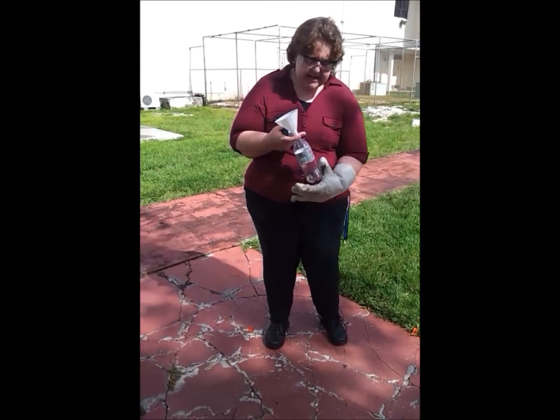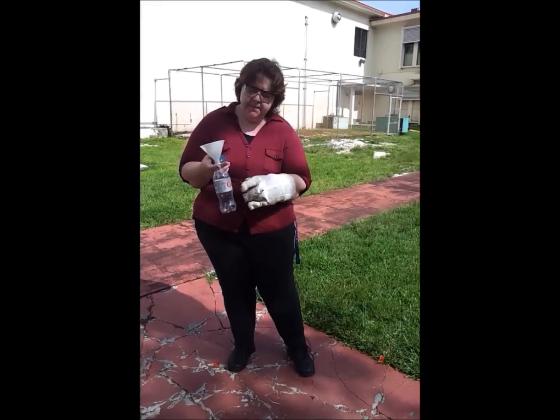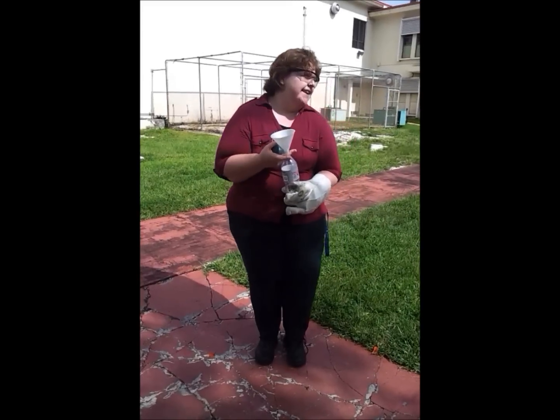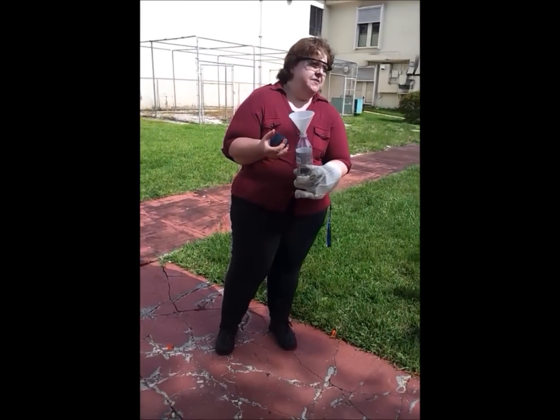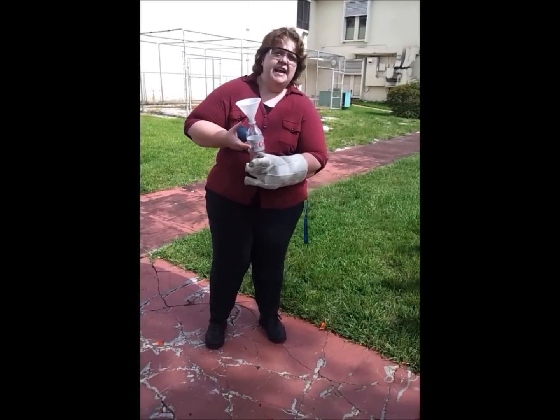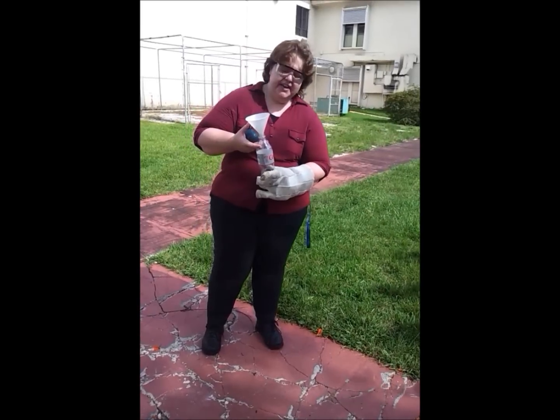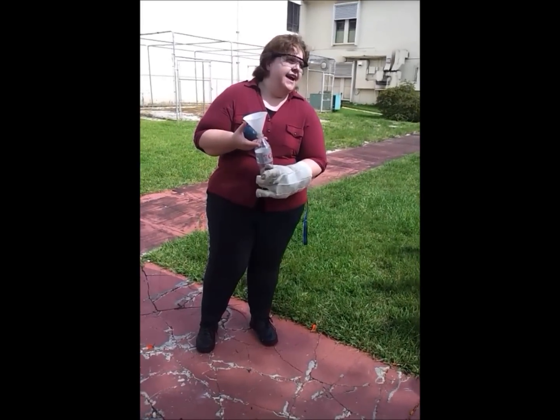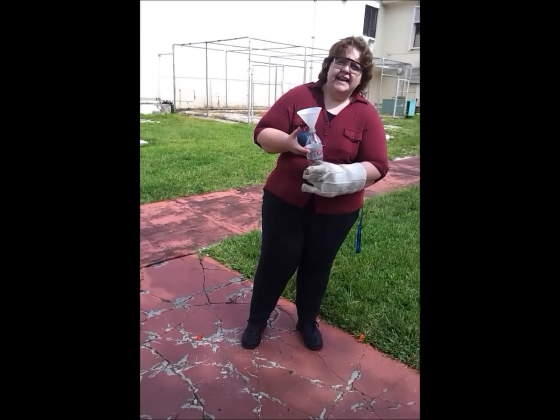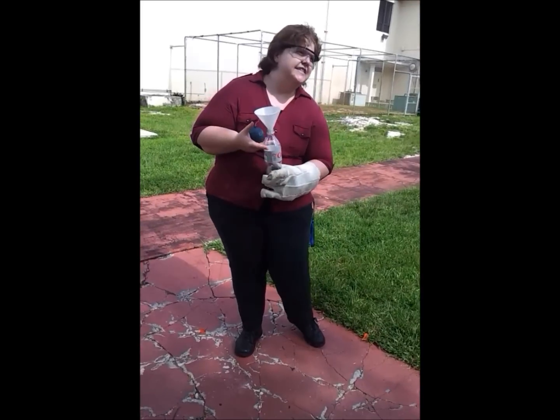So what we're going to do is partially fill this coke bottle with liquid nitrogen and put the cap on it. Once I put the cap on, it becomes a time bomb because the liquid nitrogen is going to start evaporating, increasing the pressure inside the bottle until the bottle explodes. And when it increases that pressure, it's also increasing its volume.